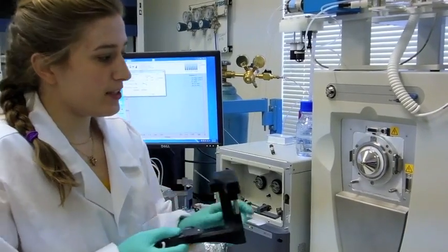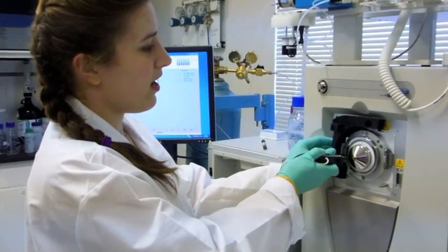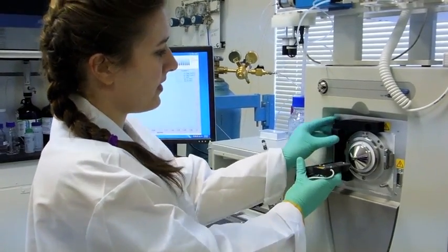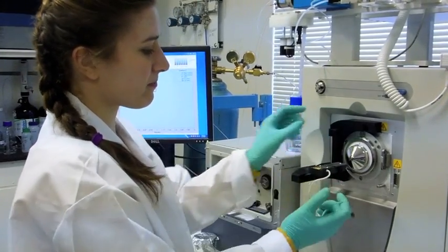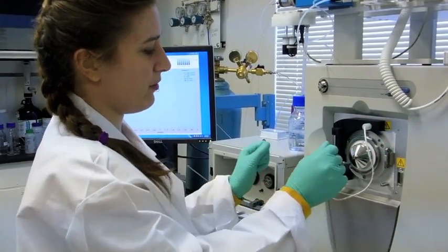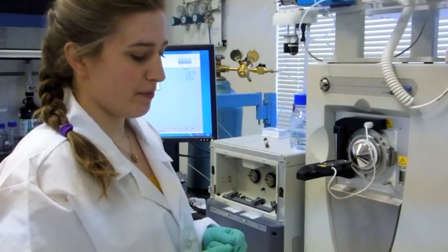This is a Picochip source. It's very easy to install. All you do is slide it in, engage the locking lever, insert the high voltage connection, and you're ready to go.